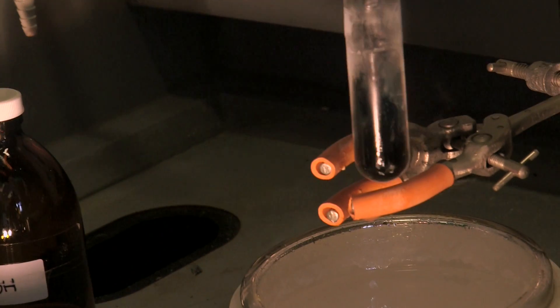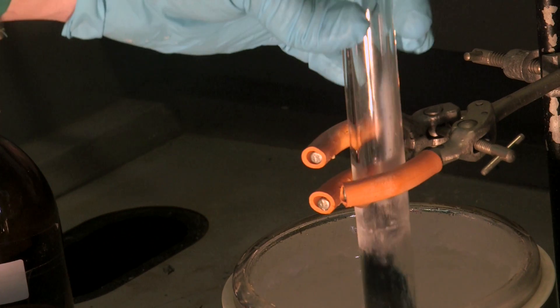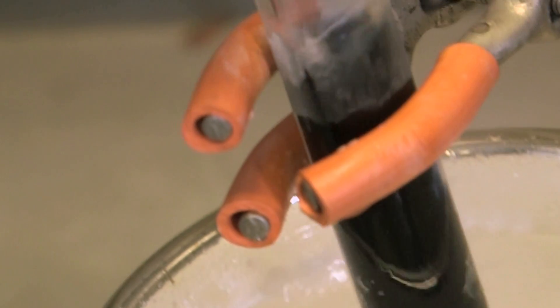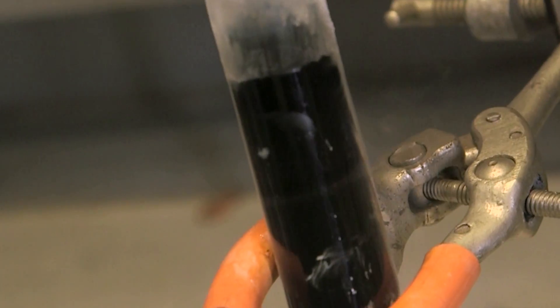So it's going a nice deep blue color. I'll just dip that back in to keep it cold. Wow, it's like ink.